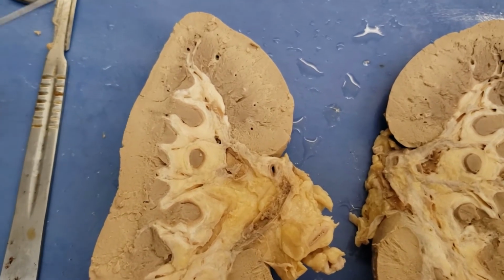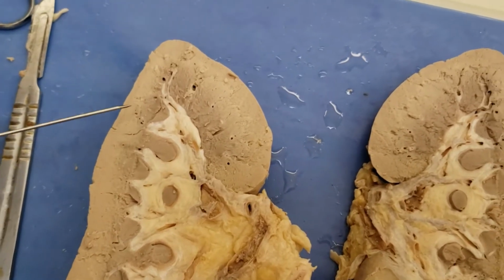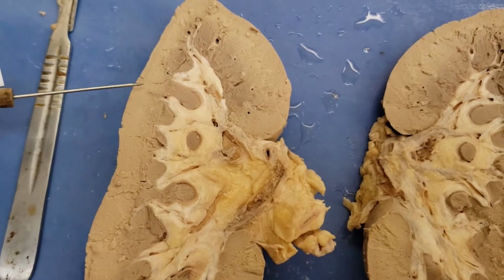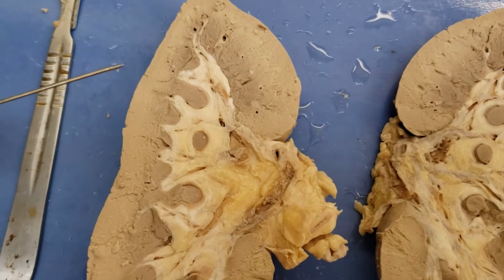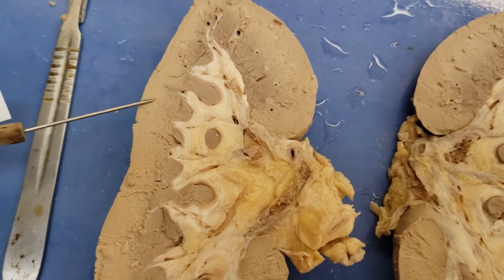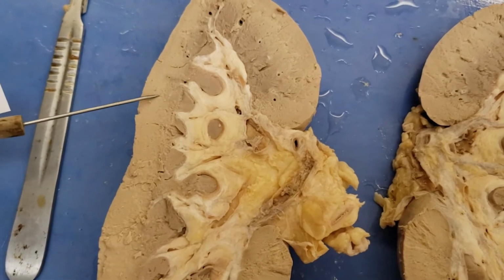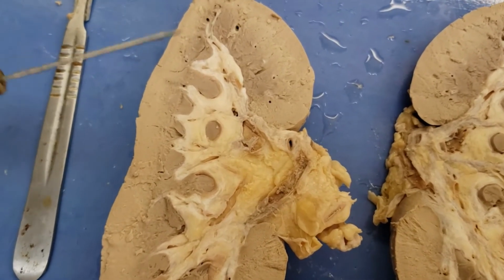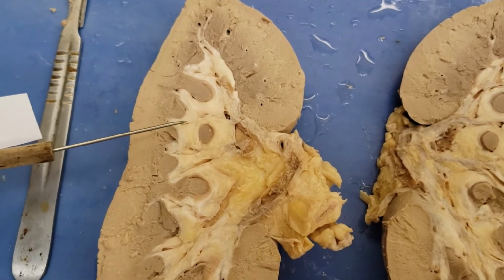But this is where the blood comes in, and it's first filtered. So when blood is filtered out, fluids taken in, ideally not blood cells unless you have a condition, this is the first stop it'll go. And so for most of us, it'll do most of the filtering here in the cortex, and then it'll eventually pass through the other structures into this area via a structure called the collecting duct, which we'll talk about in lecture.